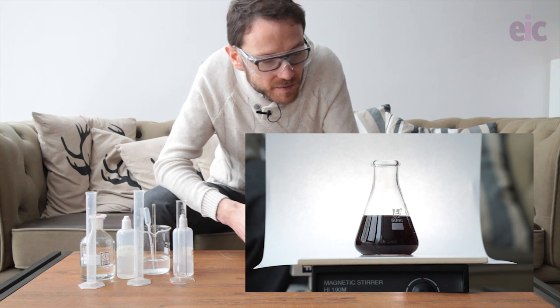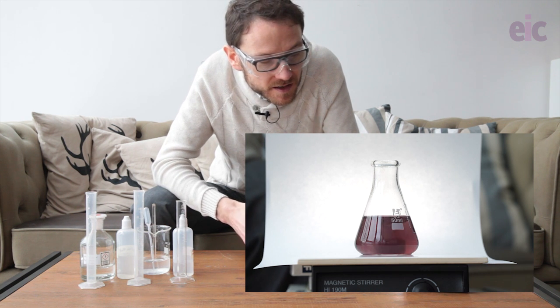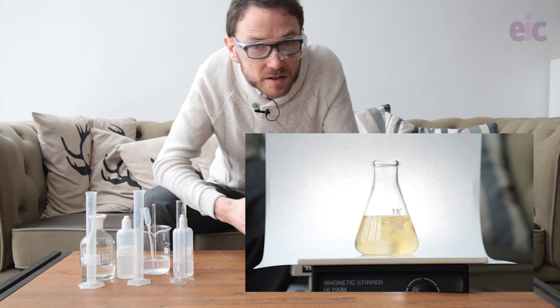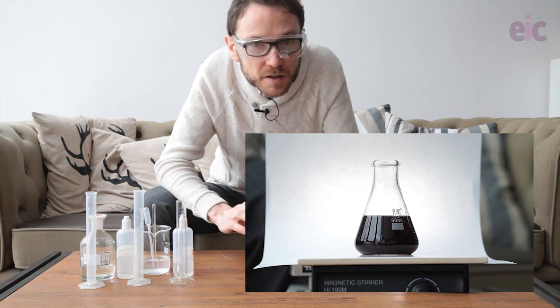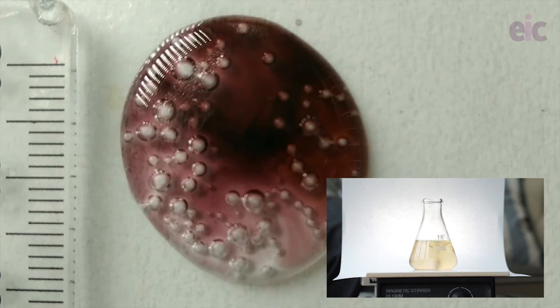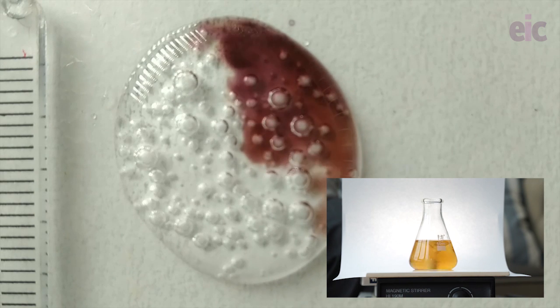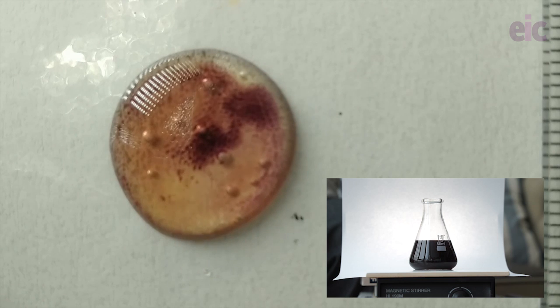This will cycle over the next couple of minutes, eventually reaching a point where all of the malonic acid is gone and we're left with an iodine-iodide complex and some iodine at the end. This reaction is totally bombproof - if you've made up the solutions and the peroxide is decent, you can scale it up and down really nicely, whether it's 20 drops or 5 drops of each solution with one drop of starch. Working with small droplets is great because you can get interesting time-lapse effects by having students video the reaction and speed it up.